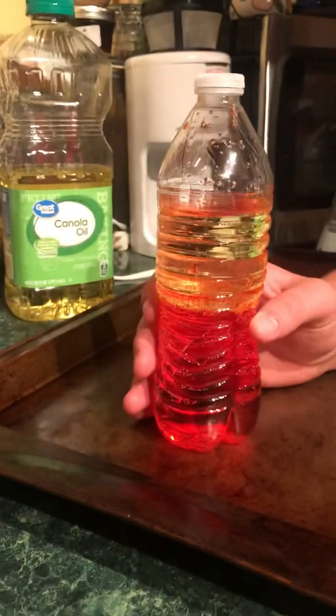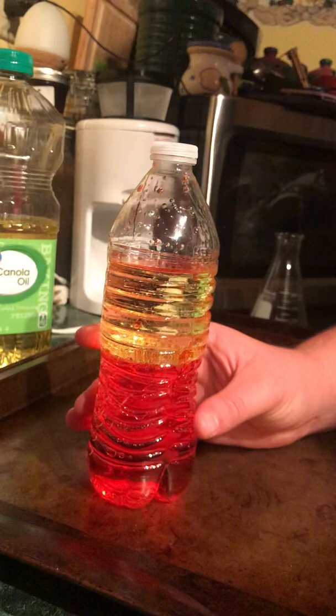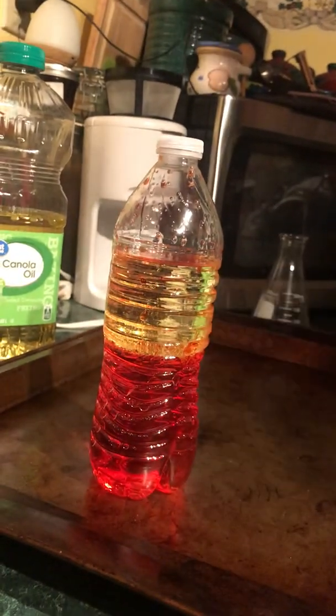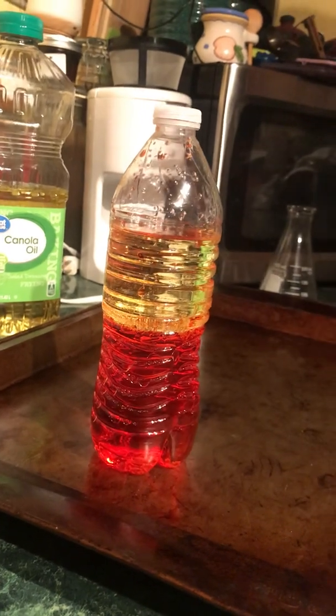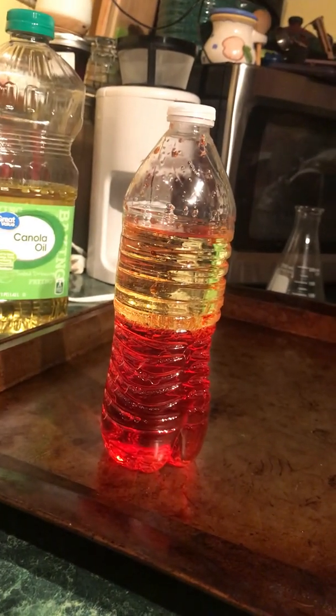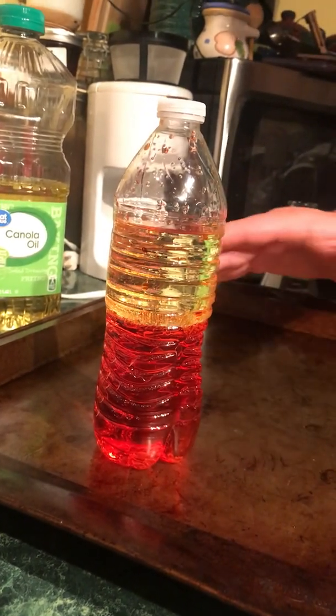And so typically this amount of oil will probably never dissolve in this water. The London dispersion forces won't occur enough and last long enough for it to completely dissolve.